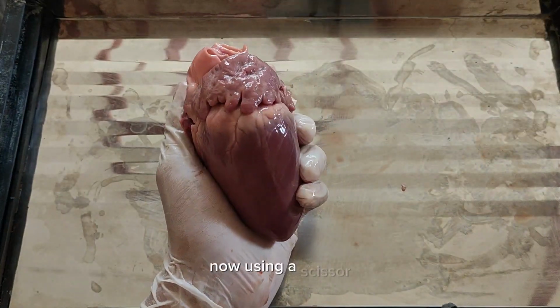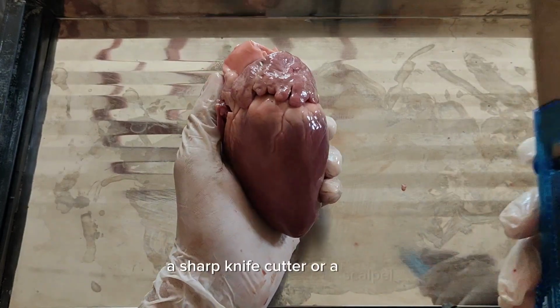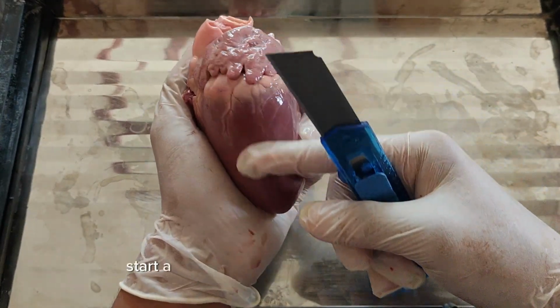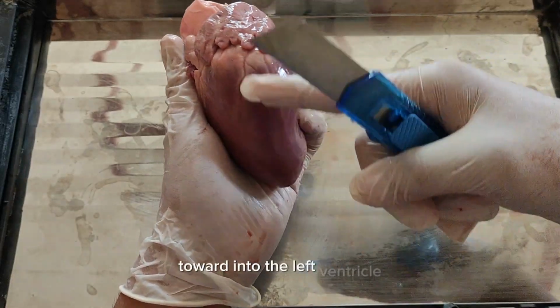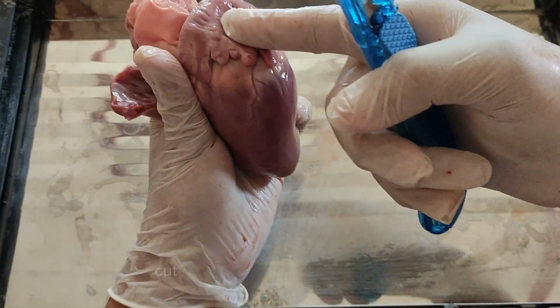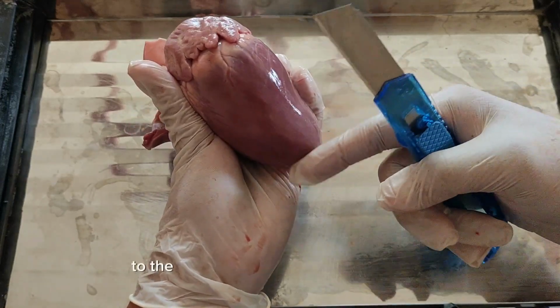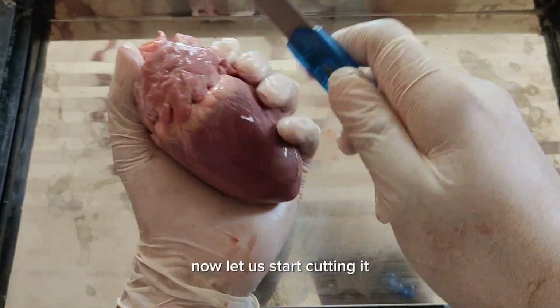Using a scissor, a sharp knife, a cutter, or a scalpel, you can use anything that you want, continue to cut open the heart. Start a cut on the outside of the left atrium toward the left ventricle, and toward the apex and the septum at the center of the heart. Now let us start cutting it.